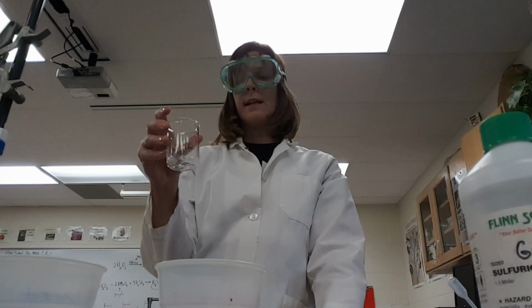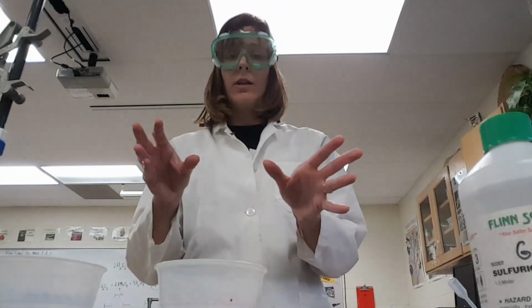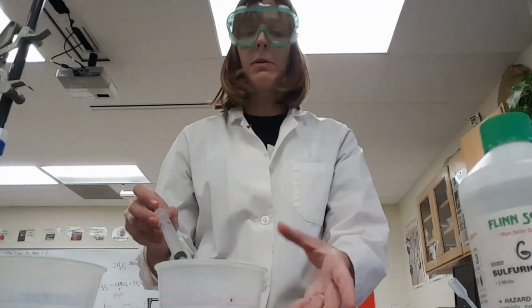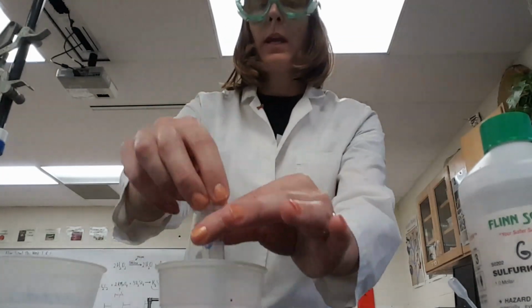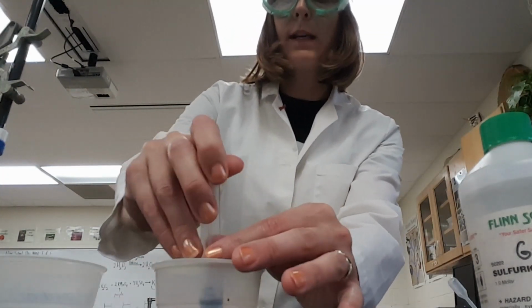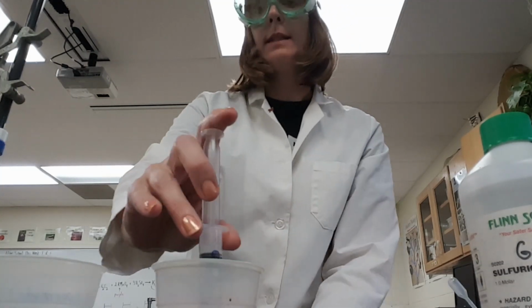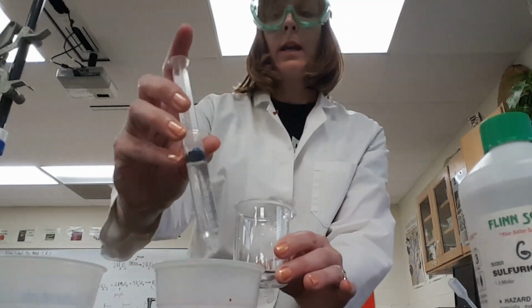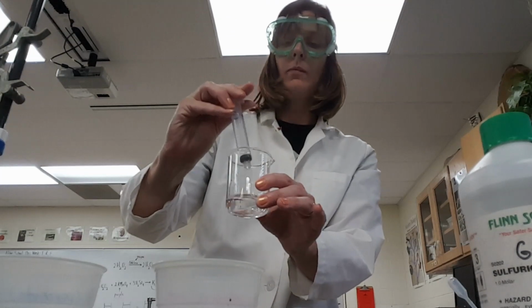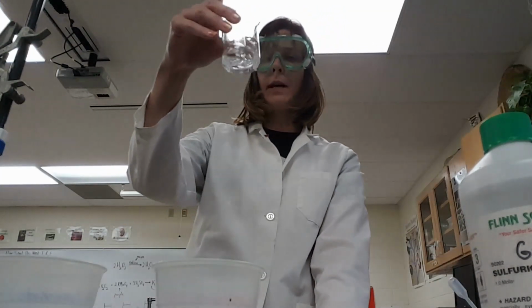Okay, after 30 seconds is up, then we need to stop this reaction, and you need to be ready to go with this. So during that 30 seconds, somebody else in the lab group needs to be in charge of the sulfuric acid. And you will have 10 milliliters of sulfuric acid all measured out and ready to go, maybe before you start your reaction, definitely by that 30-second time period. And then you're going to add your 10 milliliters of sulfuric acid. Okay? All right. So swirl that a little bit around to mix that up.